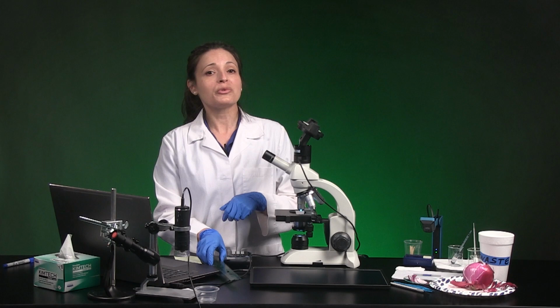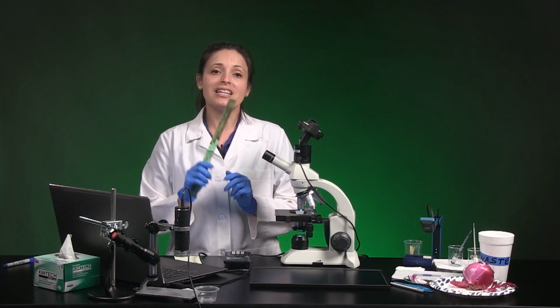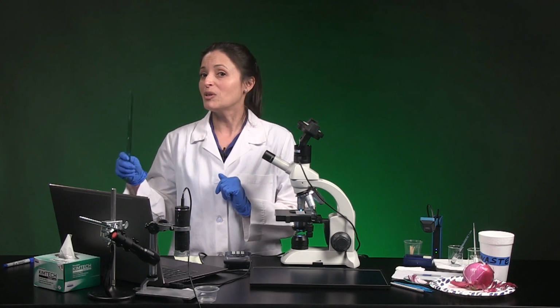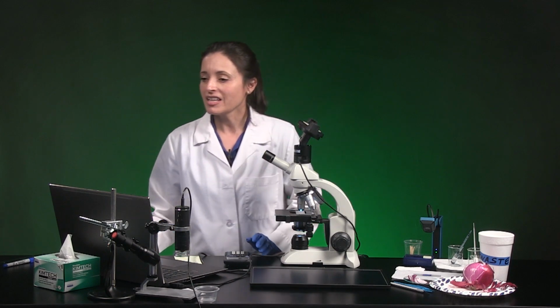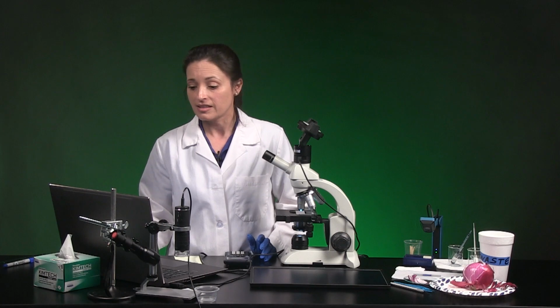Then you have to grab your ruler and measure the arrow point to point, convert to millimeters. Finally, take that ruler distance in millimeters and divide by the SPARKvue arrow distance. It should be bigger than the last one. You're going to round your answer to a whole number and make a note of the screen magnification for the 10x objective lens on your answer sheet.